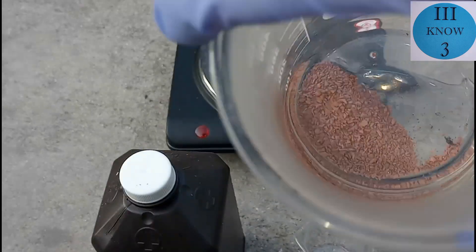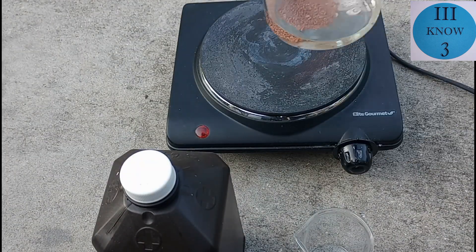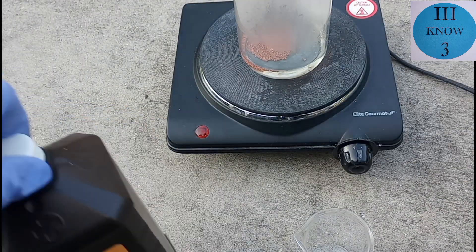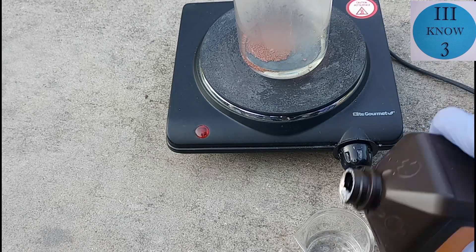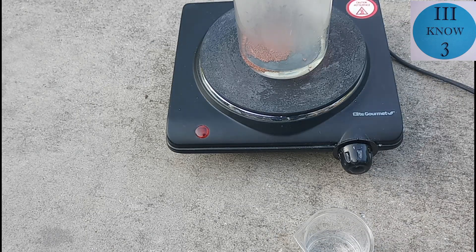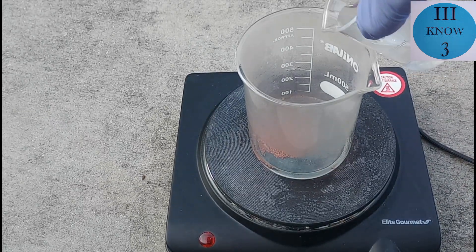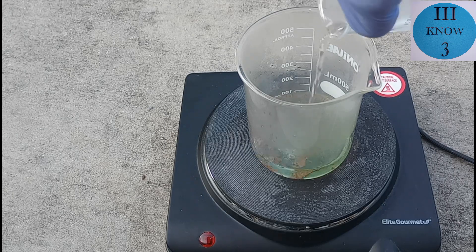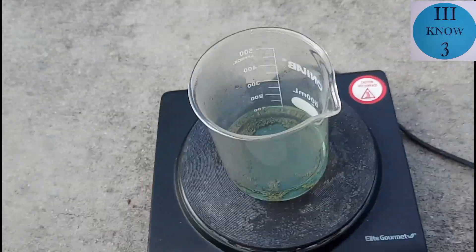After a little while longer we decided to add some hydrogen peroxide to make the copper and whatever else was left in there dissolve into the hydrochloric acid. The hydrogen peroxide will act as an oxidizer and convert the copper into copper oxide, and then the hydrochloric acid will be able to dissolve it.